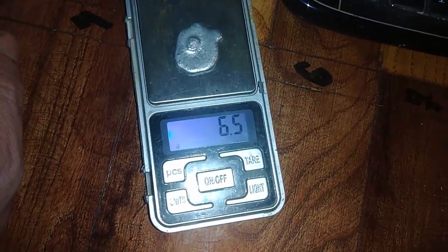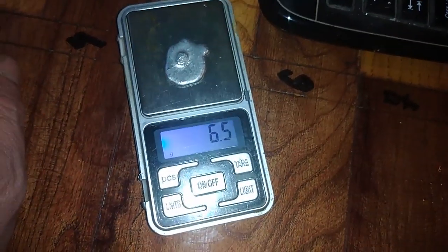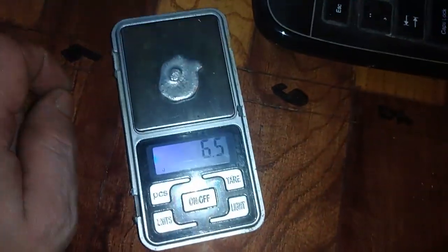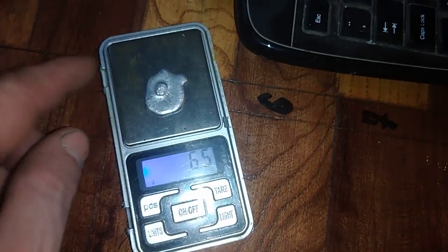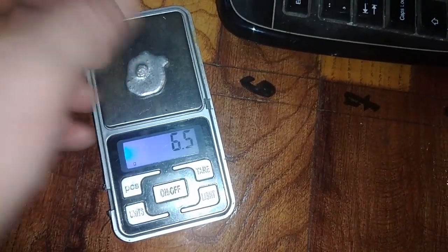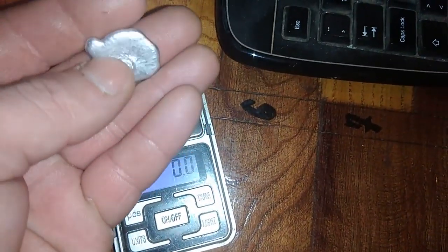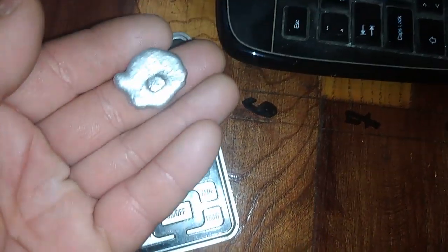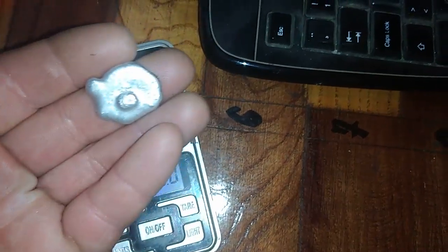6.5 grams of silver from 170 grams of wire. Basically not bad, because if this stuff were gold, this would be just amazing. But because it's silver, it's just cheap. And definitely I hope that silver someday will be worth much more, but I'm not sure.